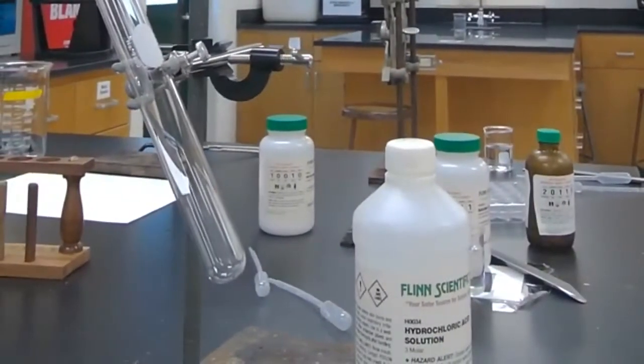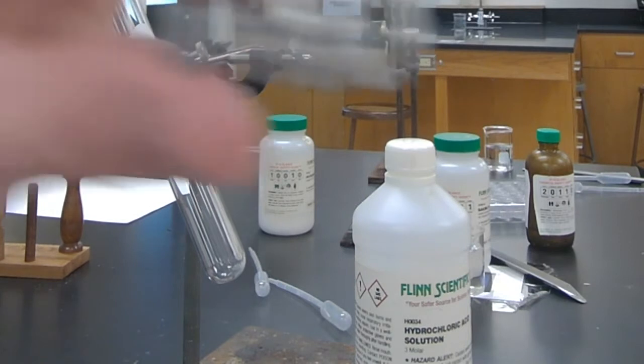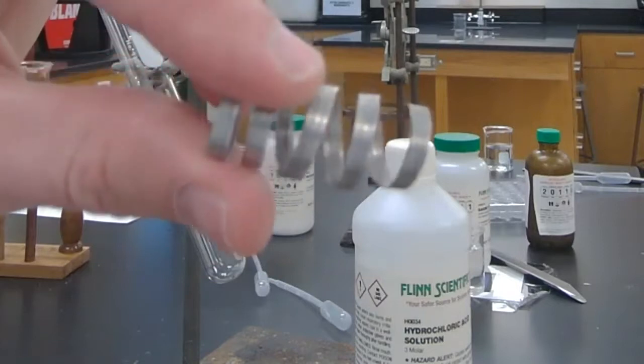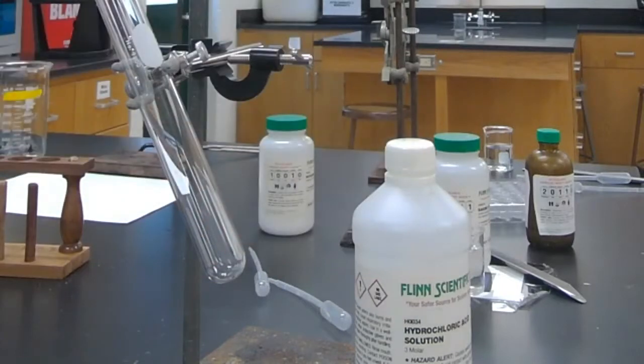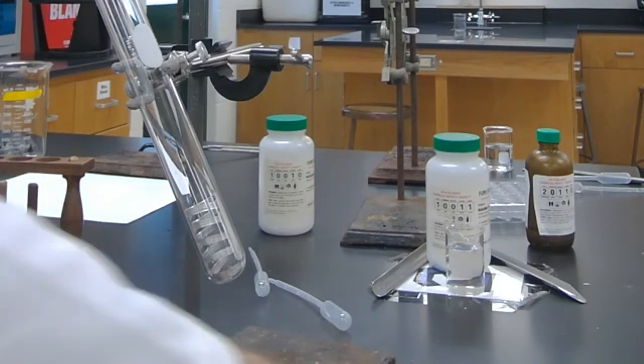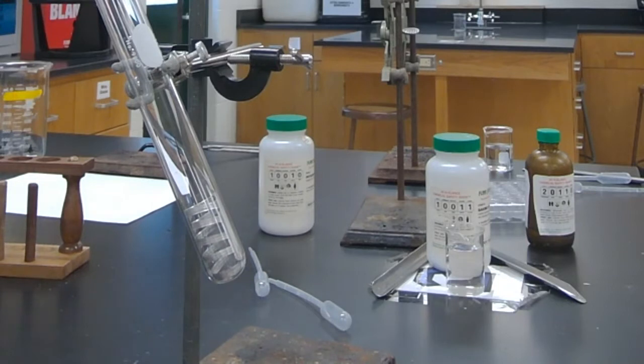You're going to see a test tube here. Station 4, it says cut a piece of magnesium ribbon. Look at that pretty ribbon right there. Magnesium, an alkaline earth metal. I'm going to put it down in that test tube there. Ooh, springy. And it says, place the piece of magnesium in a well plate. Well, I upped the amount here, so I'm going to use a test tube, and add a few drops of hydrochloric acid. So we're going to do this.